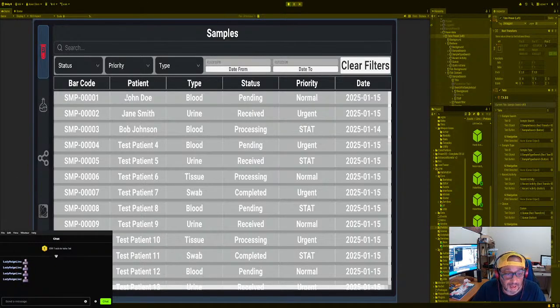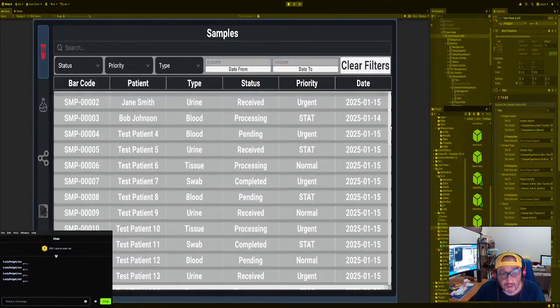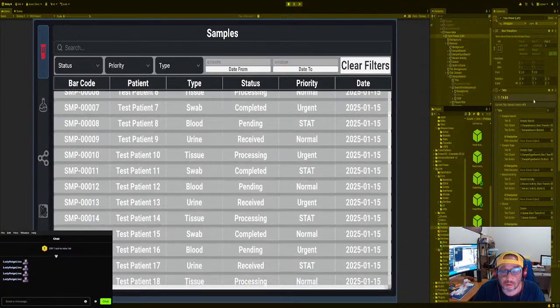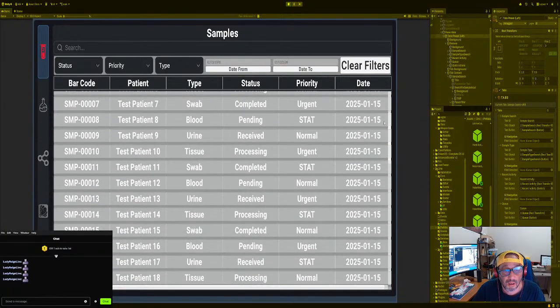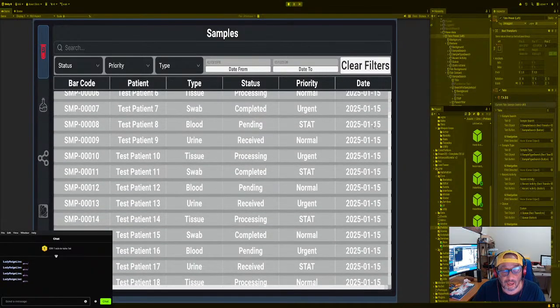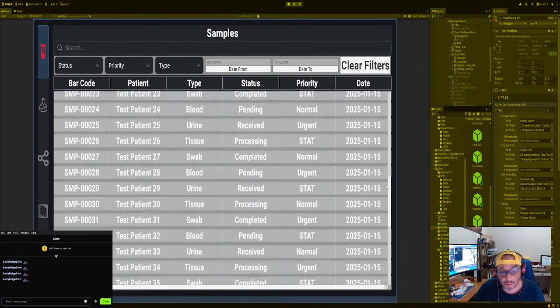Okay, now we also have this problem where this is transparent and it's going over. This needs to be beneath the handlebars, right? So I could tell that this is above. So what we're going to do is go to scroll view, go to the container. There we go. Okay. So now, as you see, you don't see that faded.